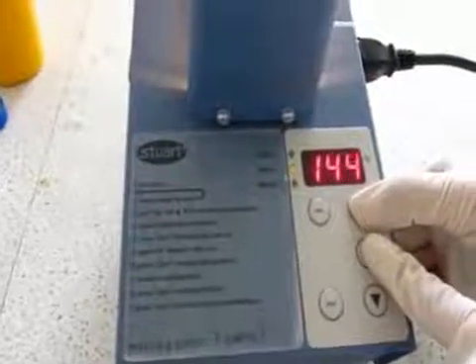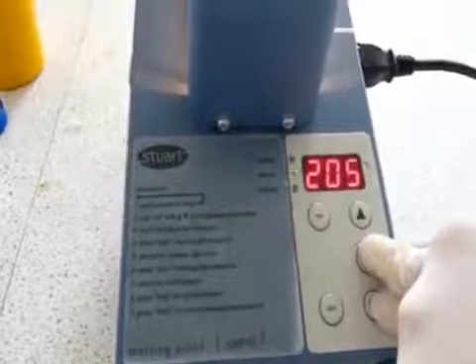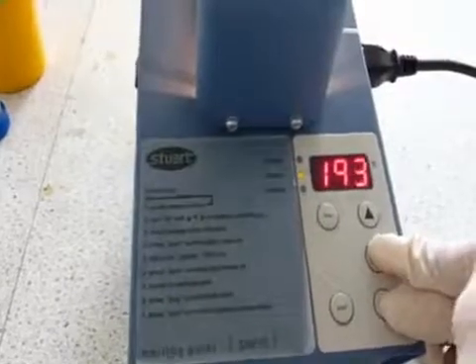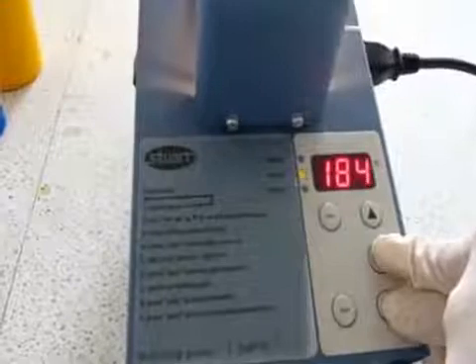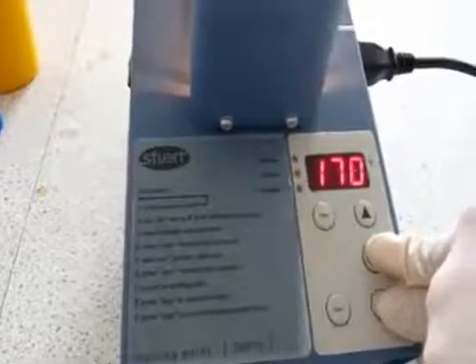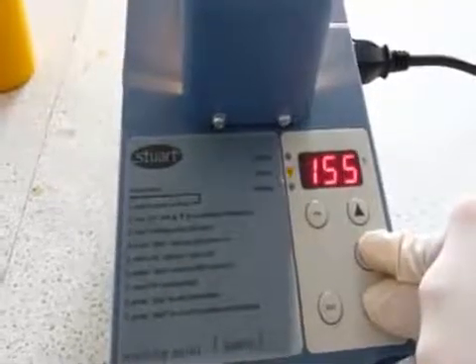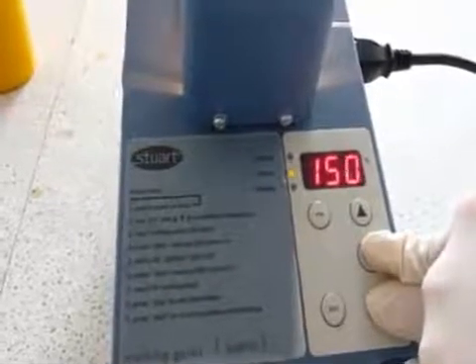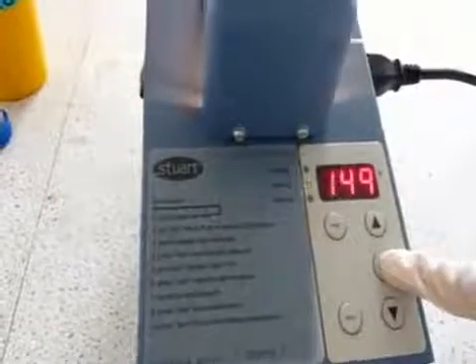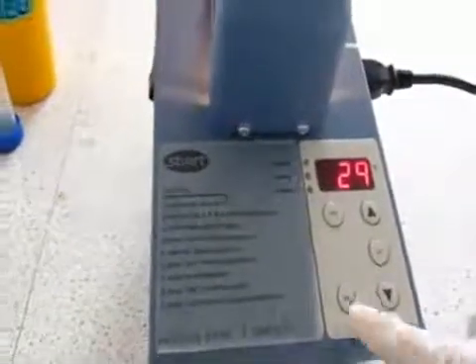The temperature will be rising very quickly to the plateau temperature you have selected. If your sample had a melting point below the set temperature, the rapid rise would give an inaccurate melting point determination. For this reason, once the plateau temperature has been reached, the temperature will increase slowly at approximately 1 degree per minute, thus allowing an accurate determination of the melting point.